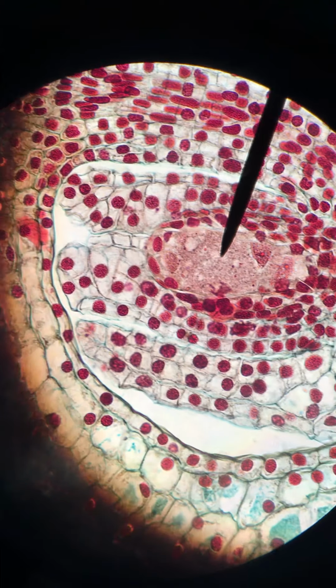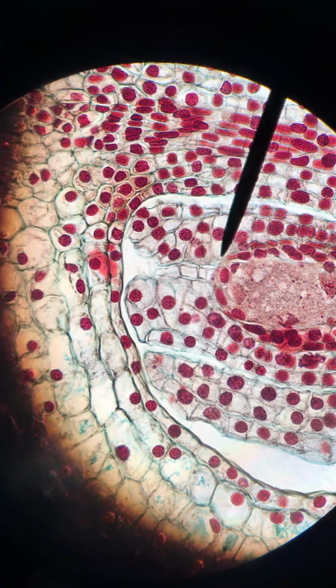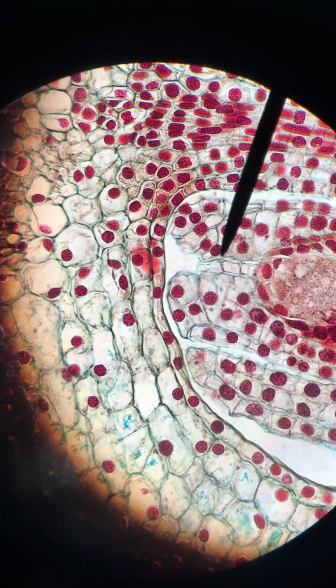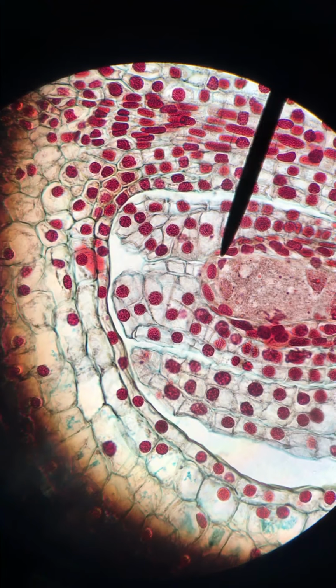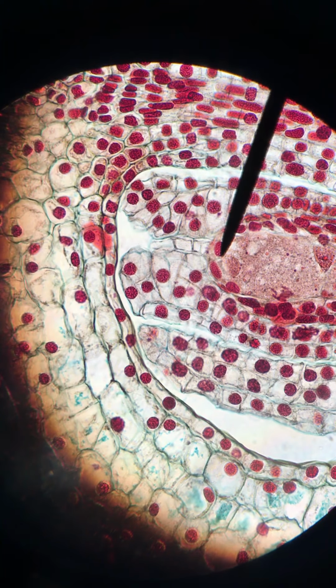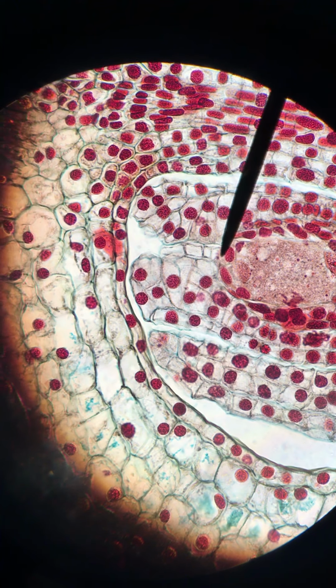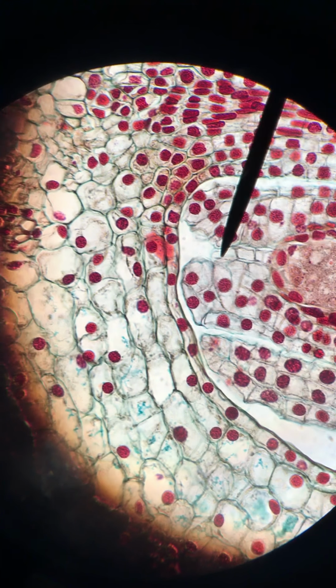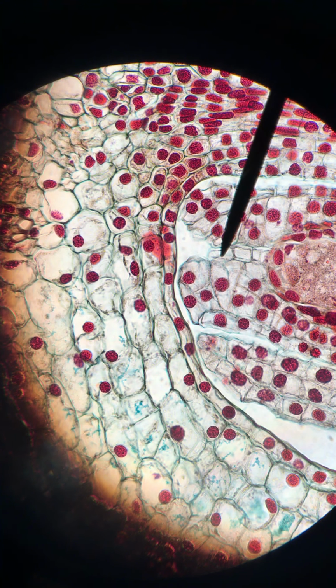So I'm going to just show you that in another ovule as well, just so you can see it a little bit better here. Here's another ovule with the integuments here. And as you can see, there's a space here. That space is the micropyle. Okay, right here. All right, so that's it for slide 7. We will continue looking at the mature female gametophyte at the 8 nucleate stage on slide 8.